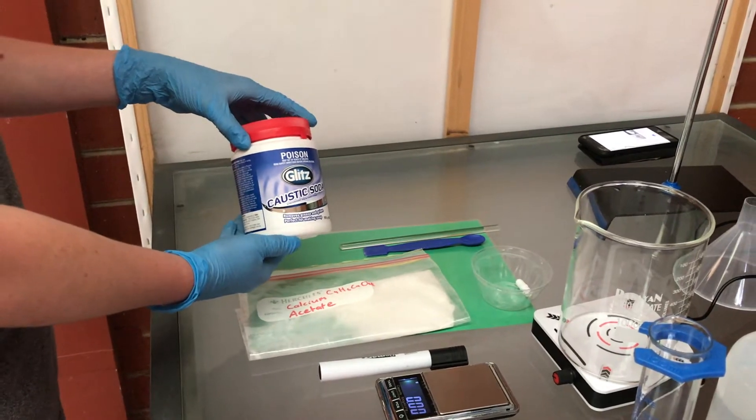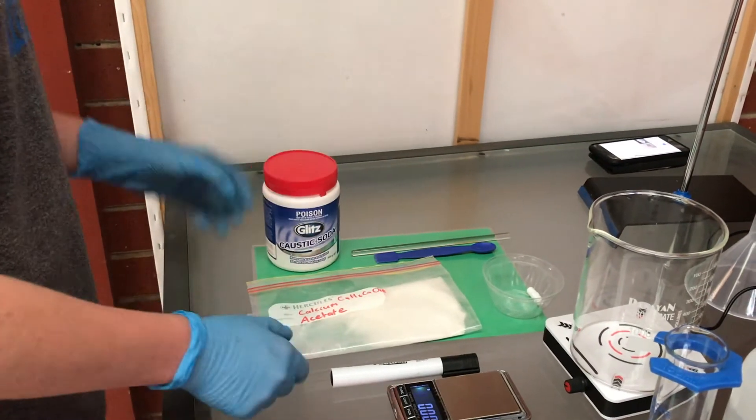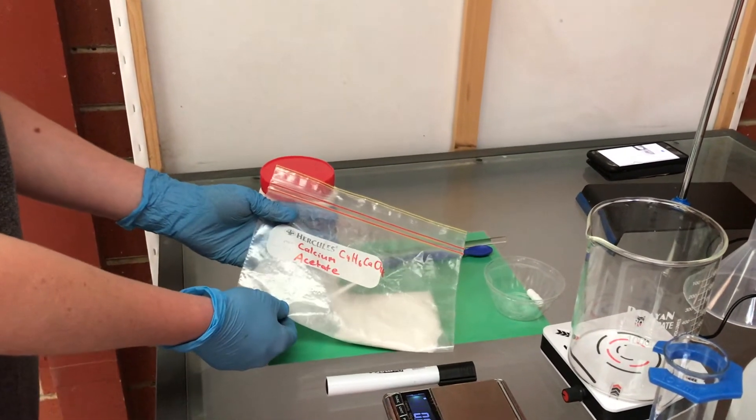In this experiment you will need sodium hydroxide and calcium acetate. I am using the calcium acetate I used in my last video.